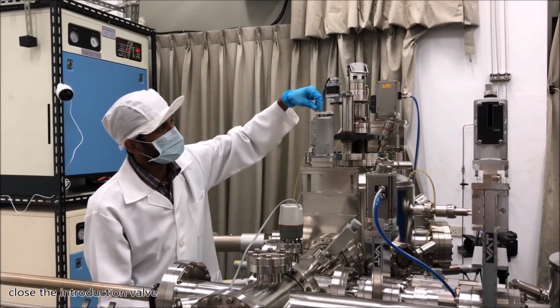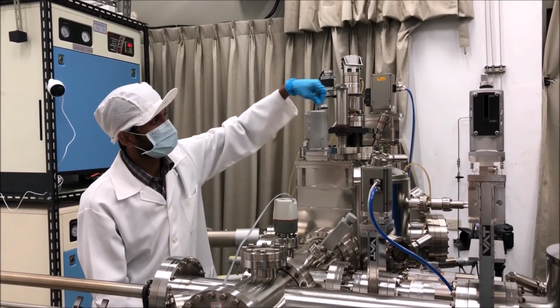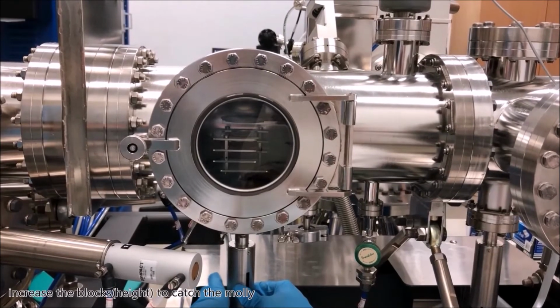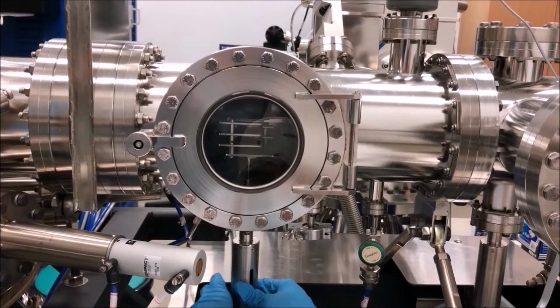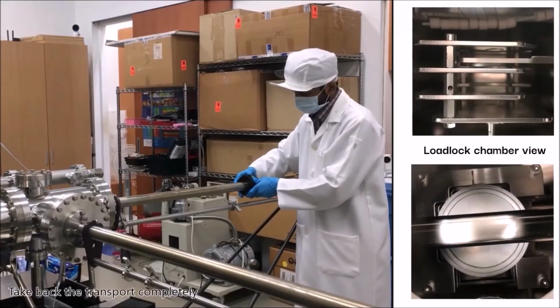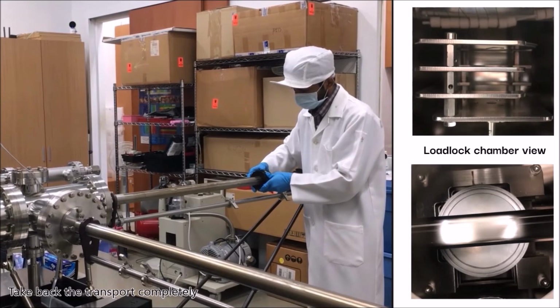Close the introduction valve. Increase the blocks to catch the moly. Take back the transport rod completely.